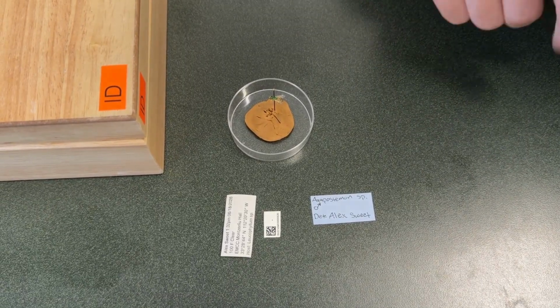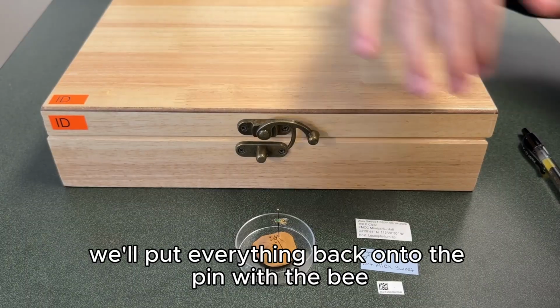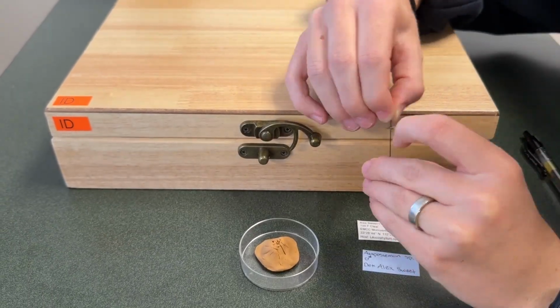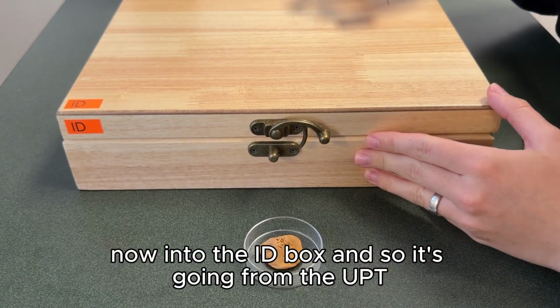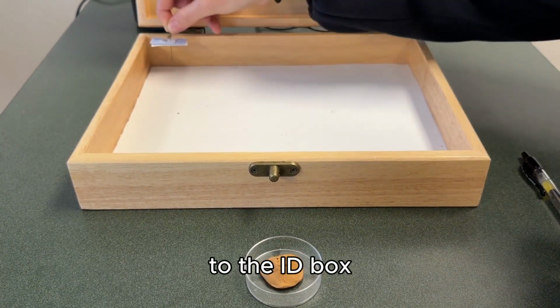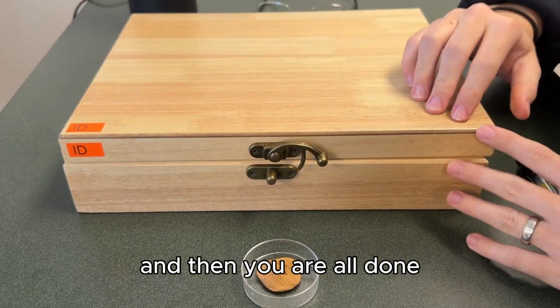All right, so now when we're done with our identification label, we'll put everything back onto the pin with the bee. We'll put our bee now into the ID box, and so it's going from the UPT to the ID box. You'll just put it at the top left area there. And then you are all done.